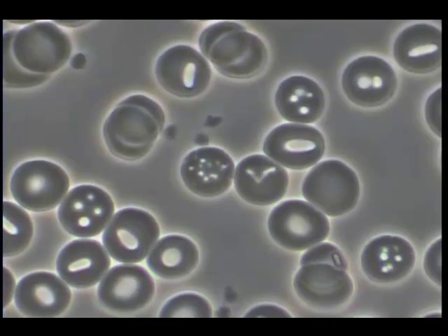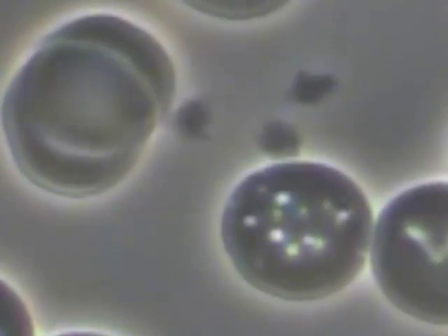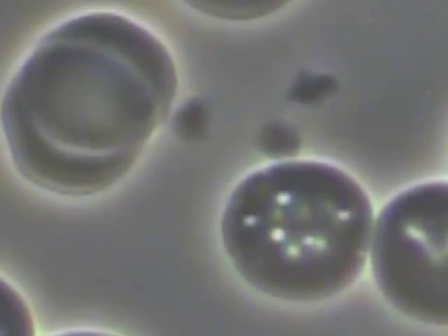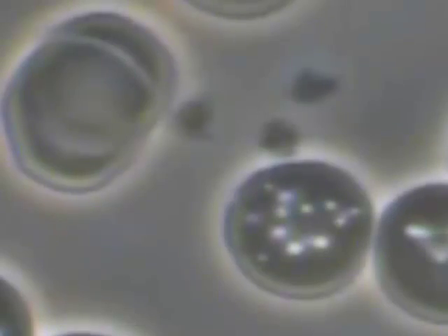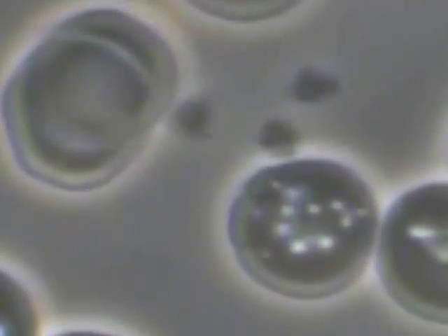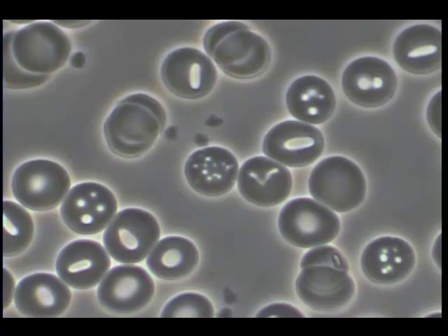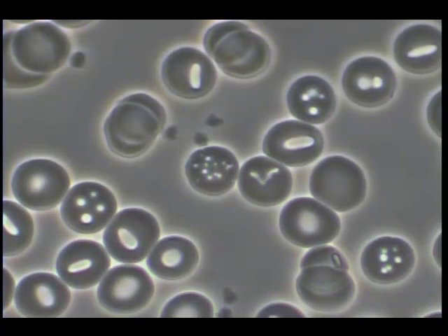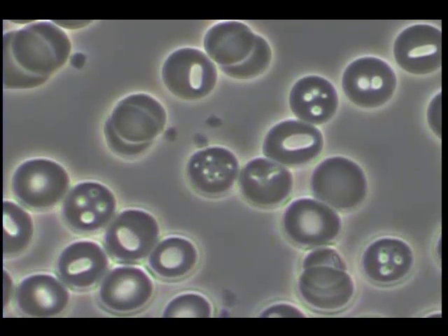Here's a cluster of curious artifacts. Obviously we can see an erythrocyte with multiple surface disturbances as well as some of these platelet-like forms.